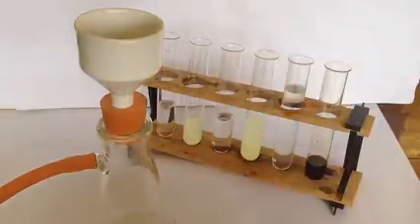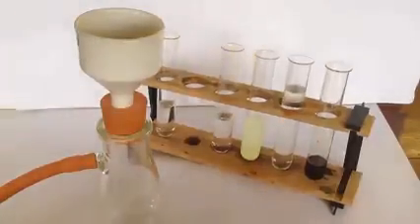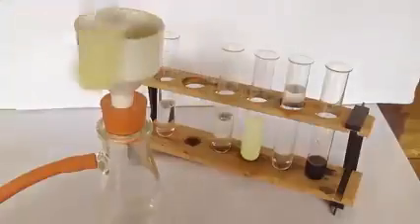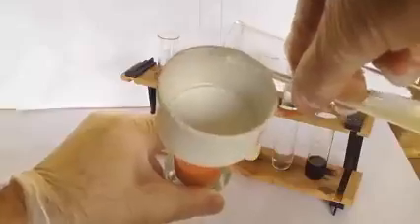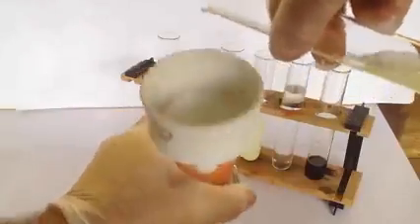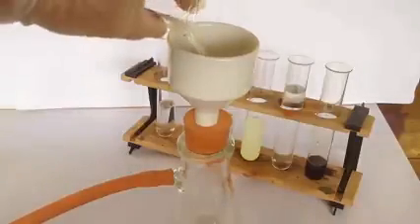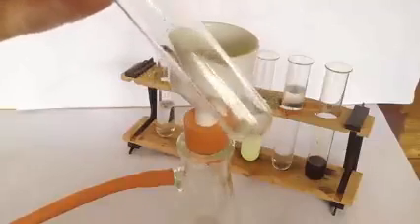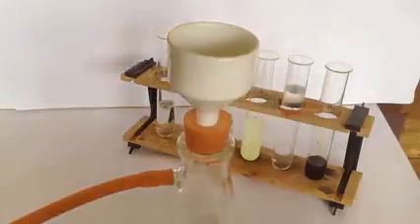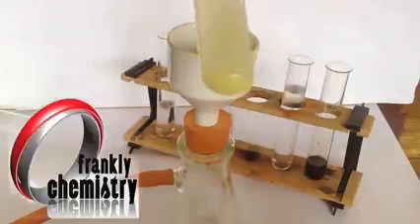Into the Buchner funnel I need to place a filter paper of an appropriate size to cover the holes. And before I pour the suspension in, I do need to wet the filter paper to make it stick down over the holes, otherwise the precipitate will go underneath, and I don't want that. So it's wetted down now with the solvent, and we can now pour it in. You can see I haven't made a great job of it there. There's still some solid left behind, some of the triiodomethane left behind there. Pour this other one in as well.